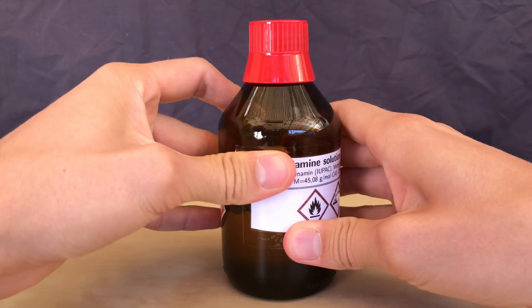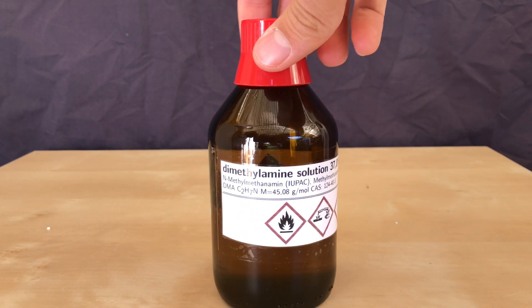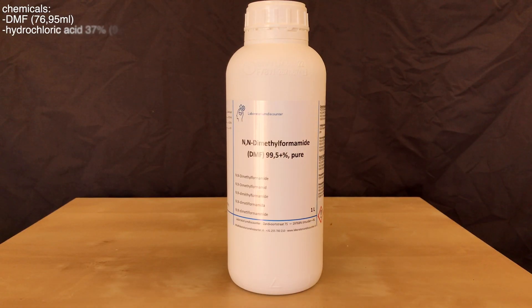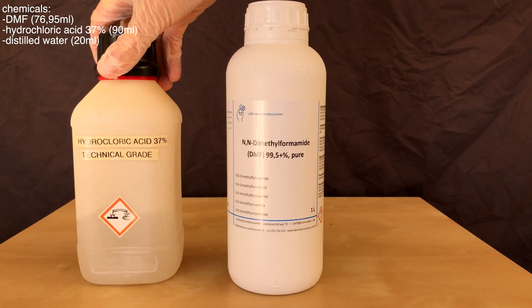There you go. This is how you make dimethylamine solution in water. I also already talked about the other way to make dimethylamine hydrochloride and I decided to try it anyways.